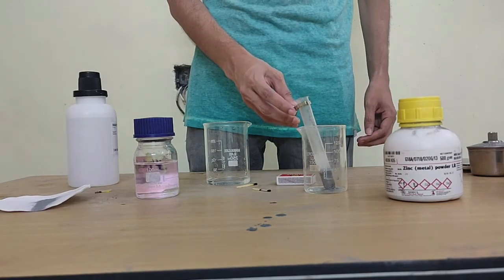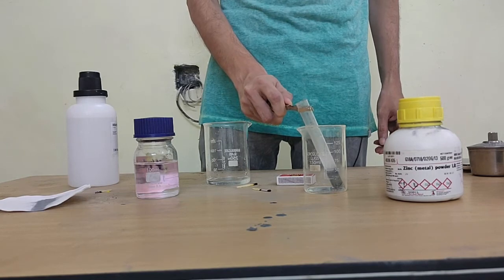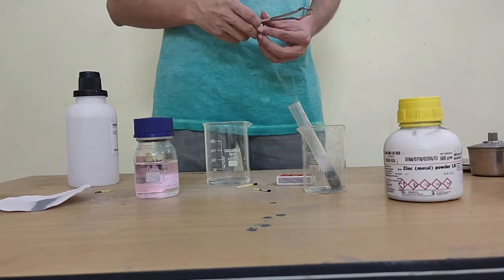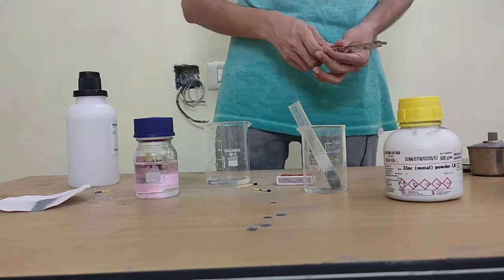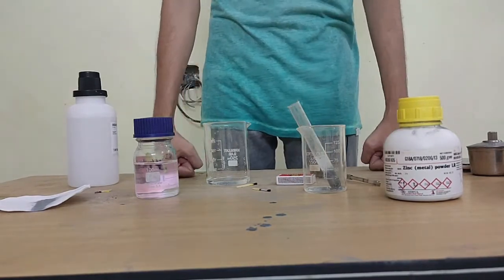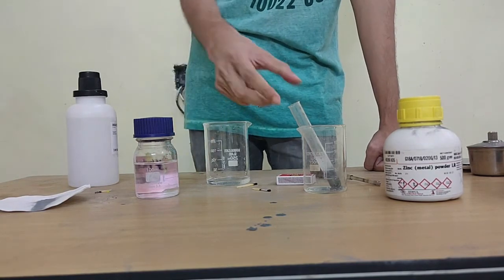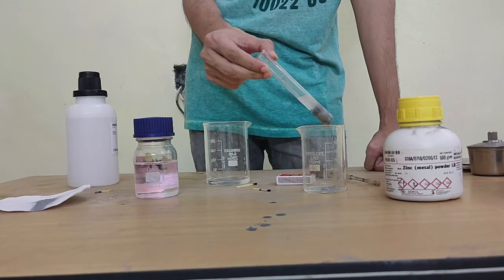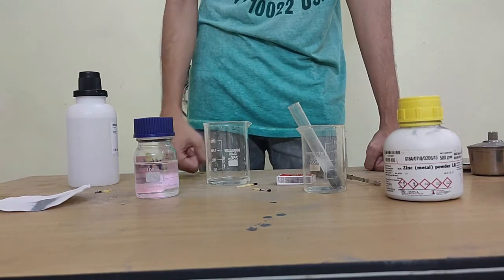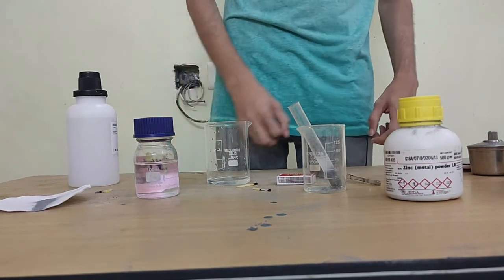So this sound happens because hydrogen gas is combustible, right? It burns with that kind of pop sound. So it's a slightly risky experiment also. You need to make sure that you're not very close to it. So to talk about a reaction, whenever an acid and a metal react, what happens is they create a gas. Now if you see the bubbles are still coming, right? It means the reaction is still happening there. It will keep reacting because there's a lot of metal. So whenever acids and metals react, they create hydrogen gas, okay.